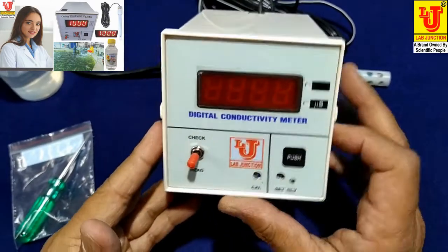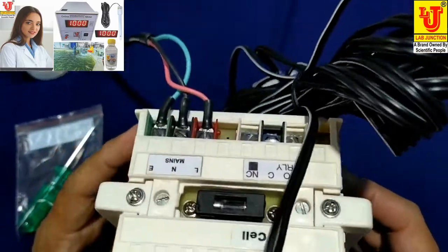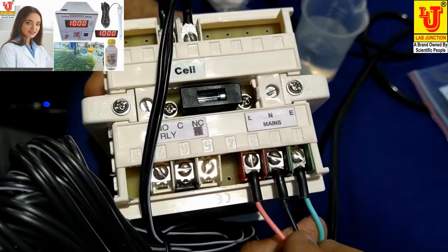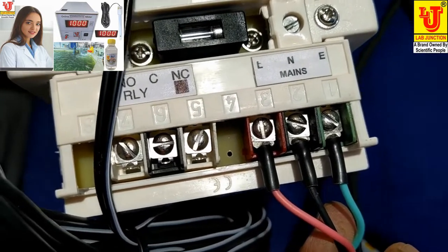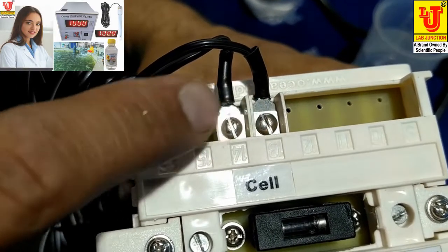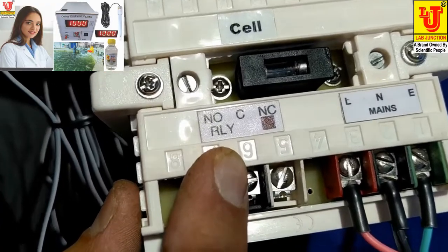This is the front panel of the instrument. I am switching on the instrument — it is direct plug and play. On the back side, these are the controls for mains. You have to correctly connect green to green, black to black, red to red. This is the connection for the conductivity cell — you can connect either of the two.